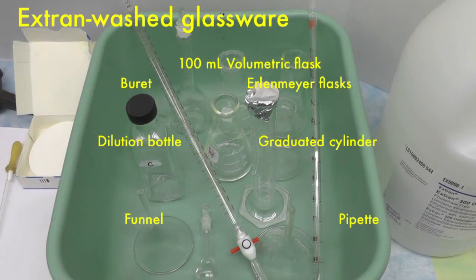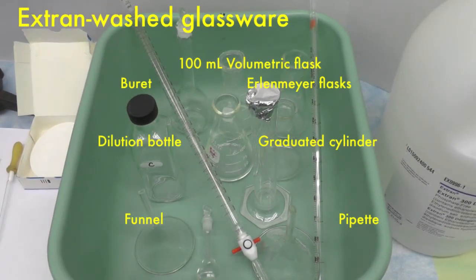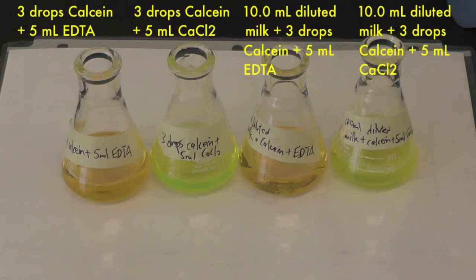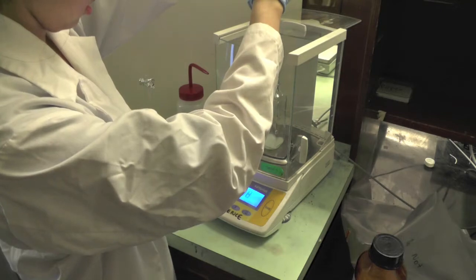For this experiment, all glassware must be washed with an extran detergent, then rinsed with DD water to ensure accurate results. You will be provided with the following solutions to use as a guide for the endpoint color changes for the titrations. First, transfer 20 grams of milk into a 100 ml dilution bottle.